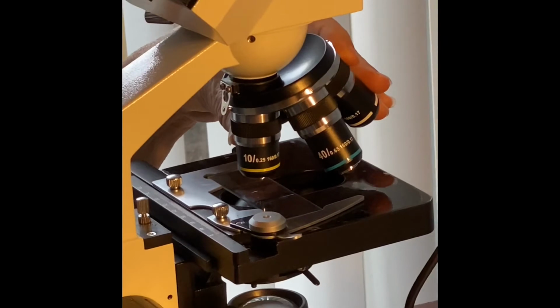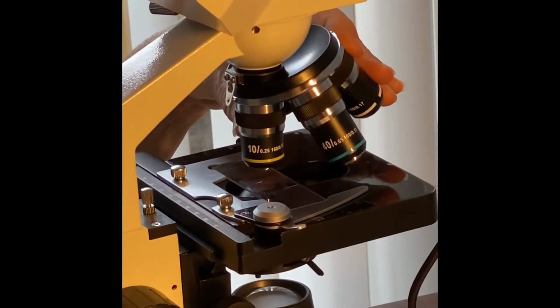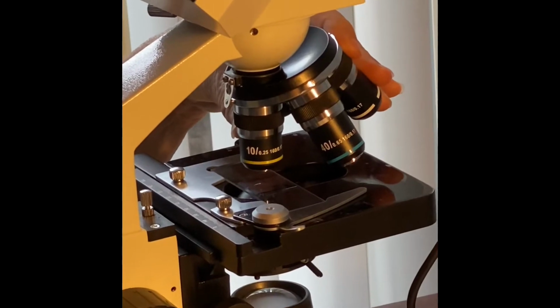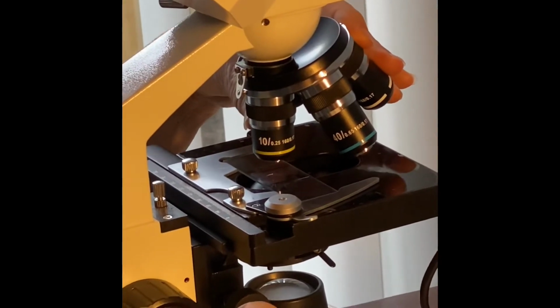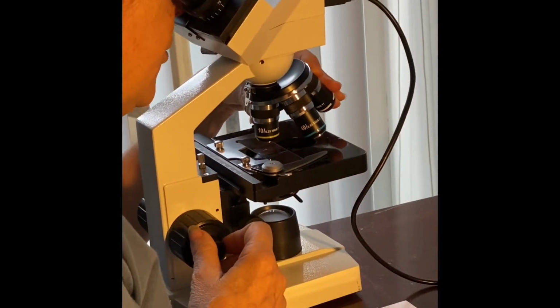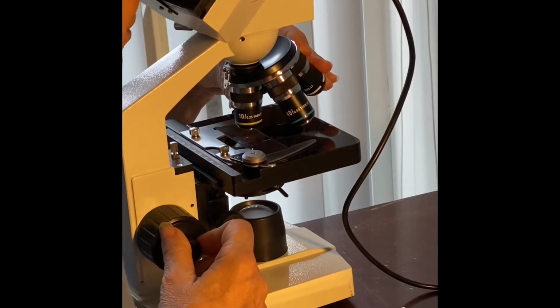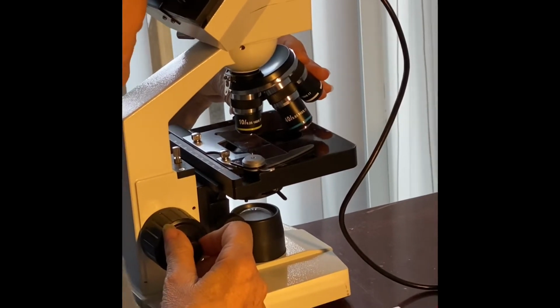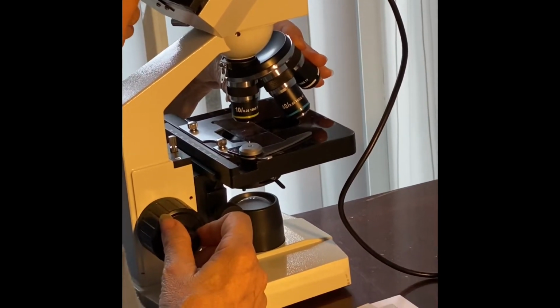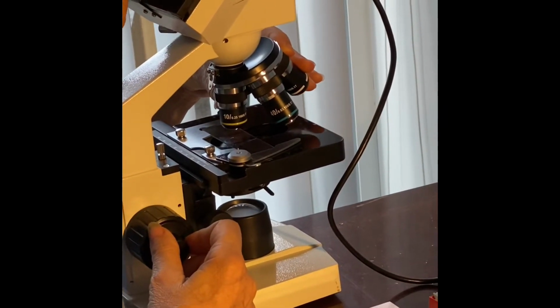There's going to be lots of cells overlapping, like I said before. So you want an individual one cell, unicellular. This is one cell only. And there are many shapes to human cells versus plant cells. There's just a few shapes that the rigid cell wall makes.